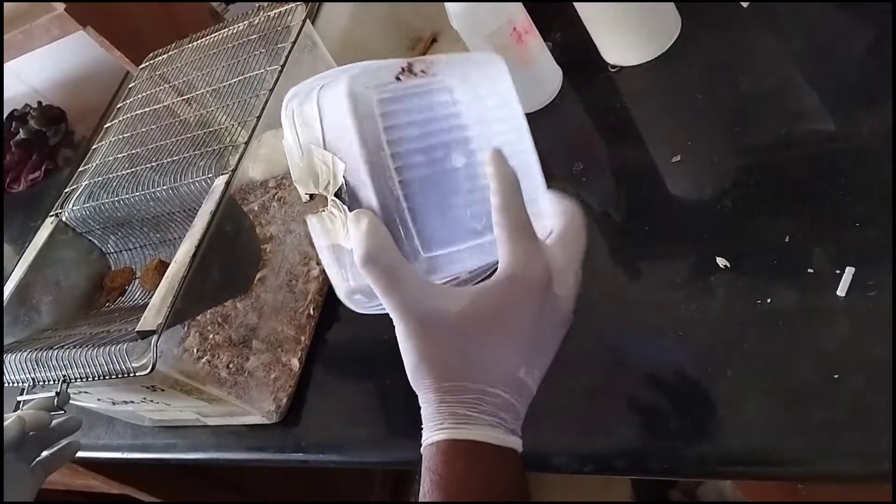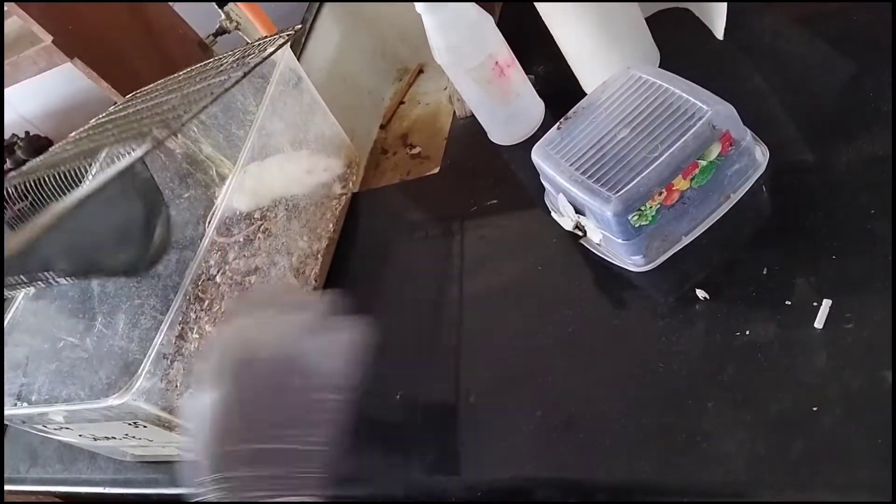I'm going to show you how we are going to do a glucose test. We will be using this box.